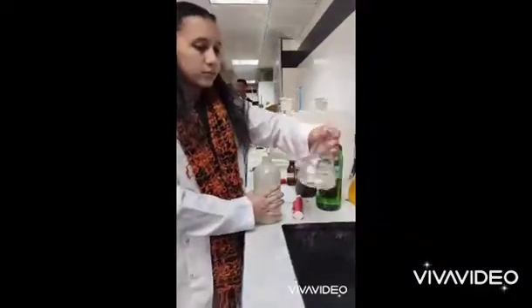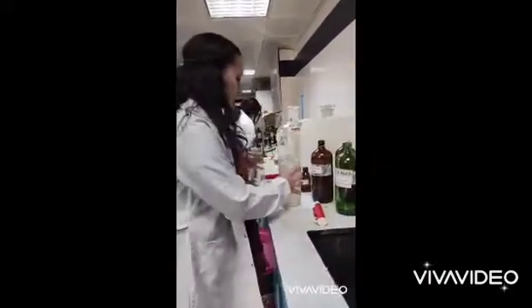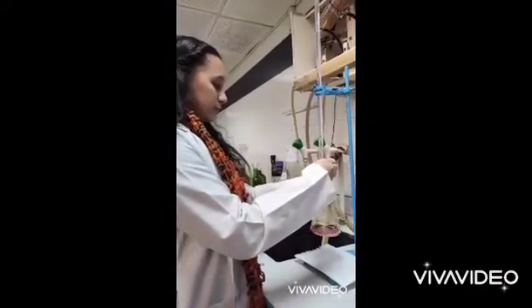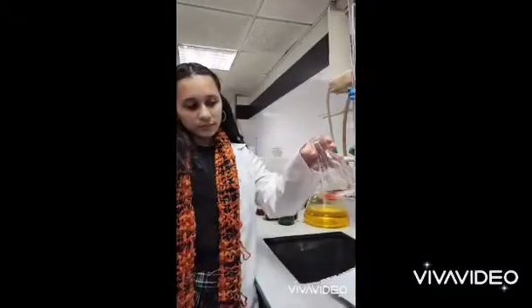Hello everyone. Now we're going to determine the concentration of HCl and acetic acid. First, wash the conical flask with distilled water. Then put 10 mL of the HCl and acetic acid mixture in the conical flask. Add 5 drops of methyl orange — the color will be red. Put NaOH in the burette to the zero mark, then start the titration. The color in the middle of titration will be orange-red, then it becomes full orange at the endpoint.